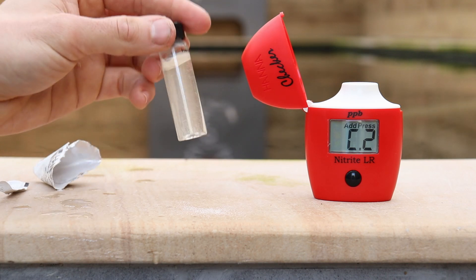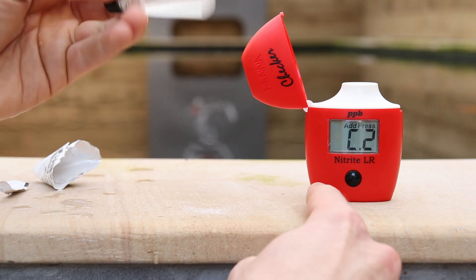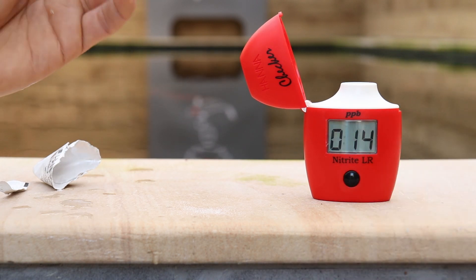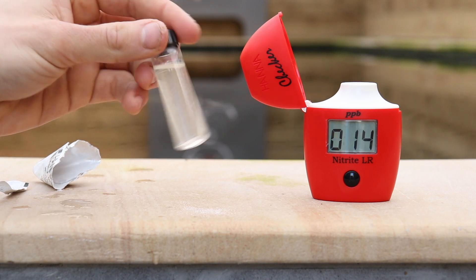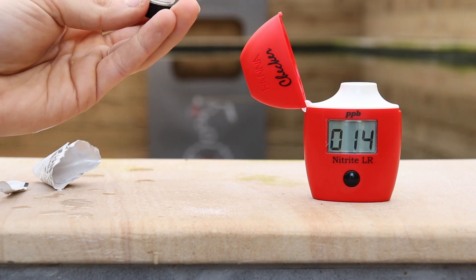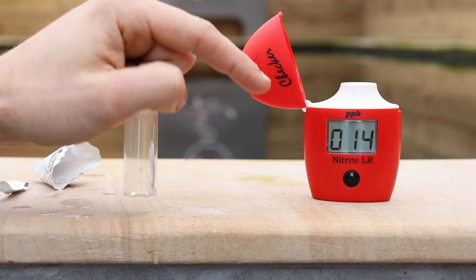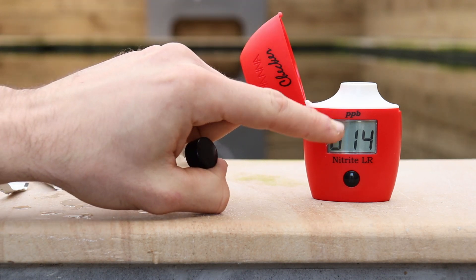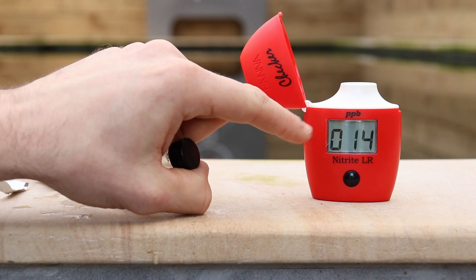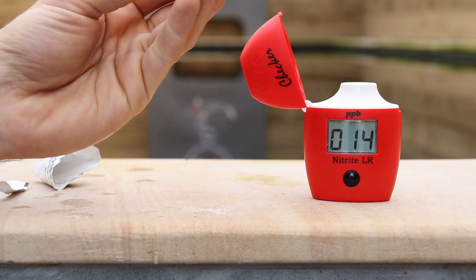So this next point is when a lot of people get very confused and end up doing something wrong. This time we need to press and hold the button on the front until a number is displayed. Now we have 15 — it's just straight away gone to 14. This is because this is a timer built into the reader which is counting down from 15 minutes. So what this will do is go 15, 14, 13, 12, 11, 10. Once you get to 10 you'll actually see the seconds displayed on the front as it counts down. But because it doesn't show this straight away, this catches a lot of people out and they think their reading is 0.14. This is not correct — this is 14 minutes still left on the timer.